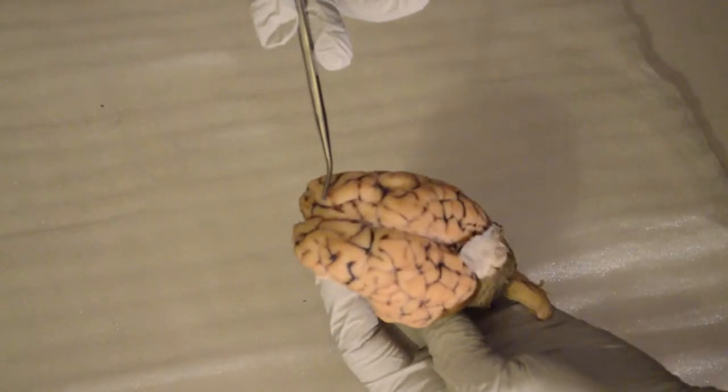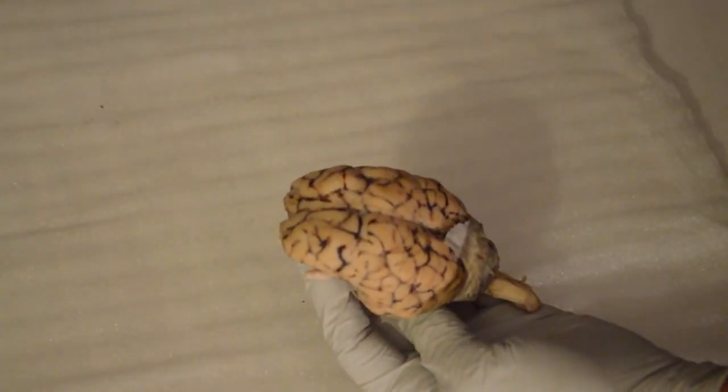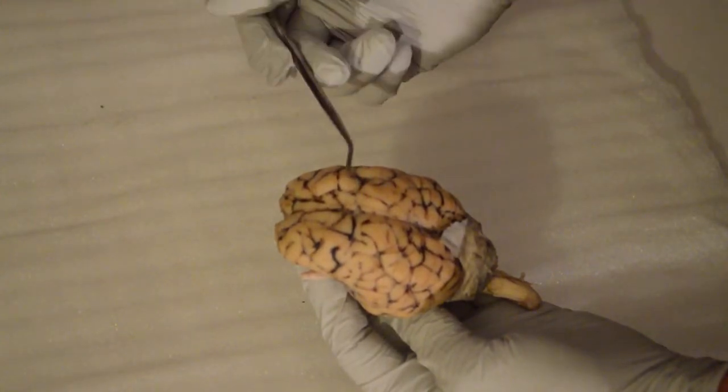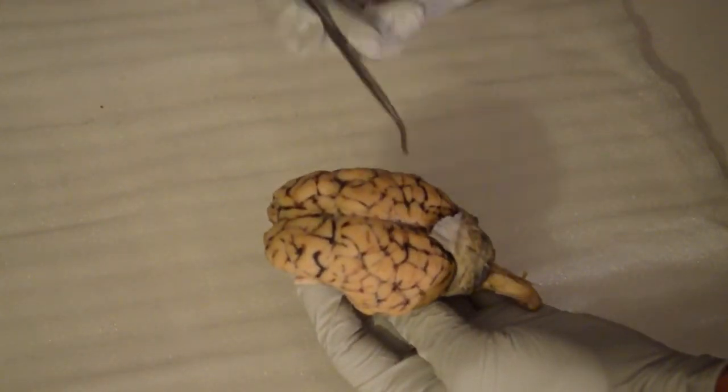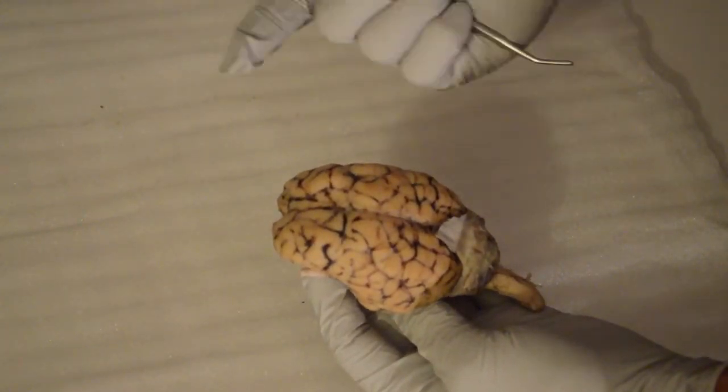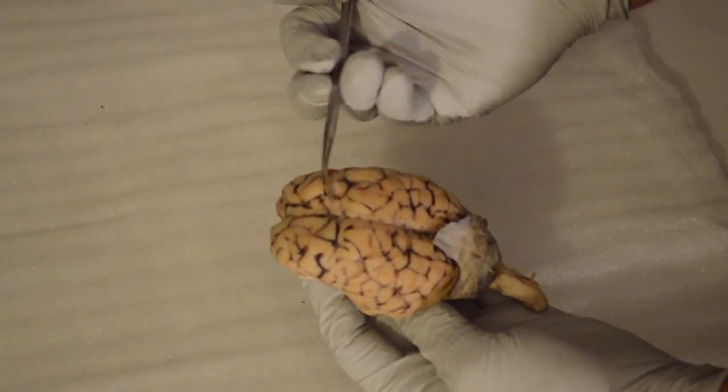The frontal is important because it involves cognitive thinking and problem solving, and even storing memory and language learning. The parietal is processing information and the senses, such as taste, the feeling of temperature, and touch. Those are really important key factors there.